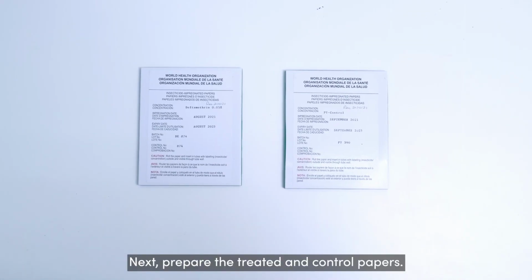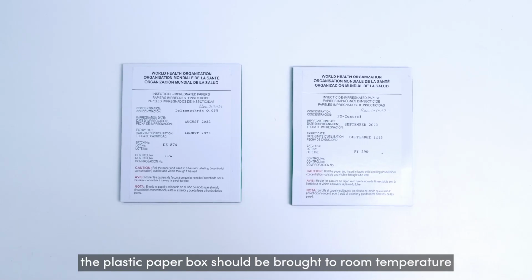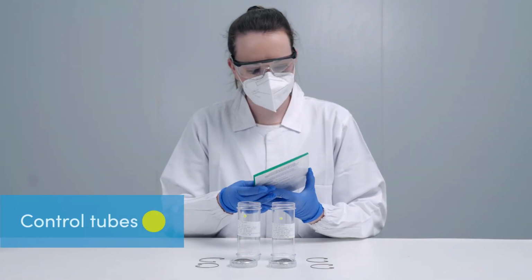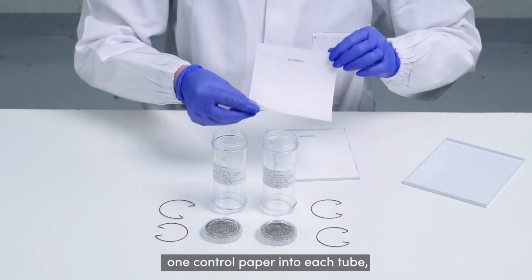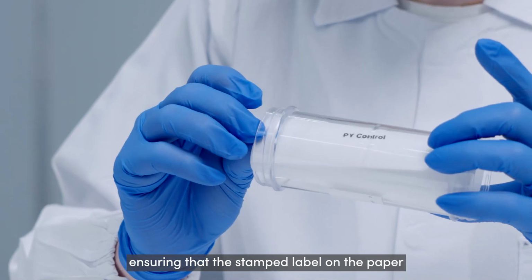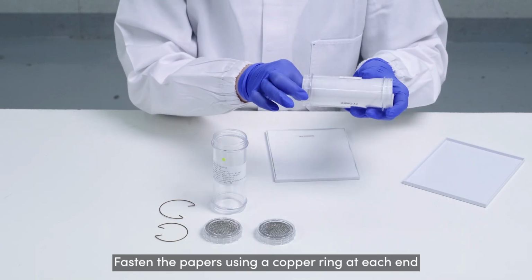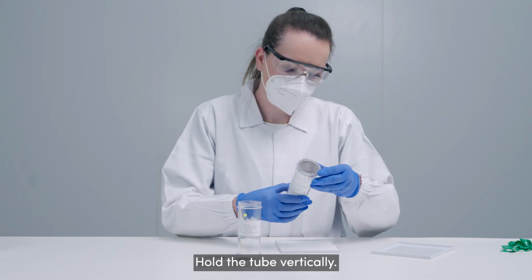Next, prepare the treated and control papers. Before using the papers, the plastic paper box should be brought to room temperature, unopened, for 1 hour. To prepare the 2 yellow dotted control tubes, wear disposable gloves and roll and insert 1 control paper into each tube, ensuring that the stamped label on the paper is on the outer side and is readable. Fasten the papers using a copper ring at each end and close the tube with a screw cap at the bottom end. Hold the tube vertically.